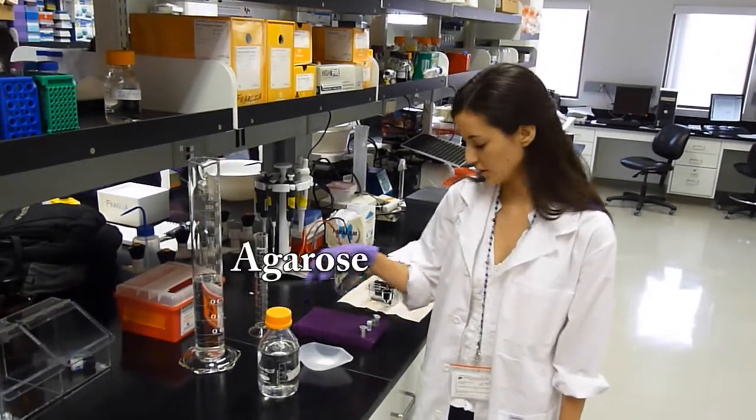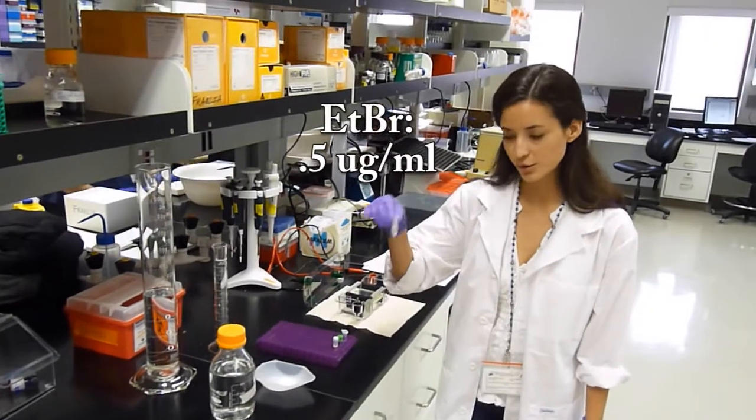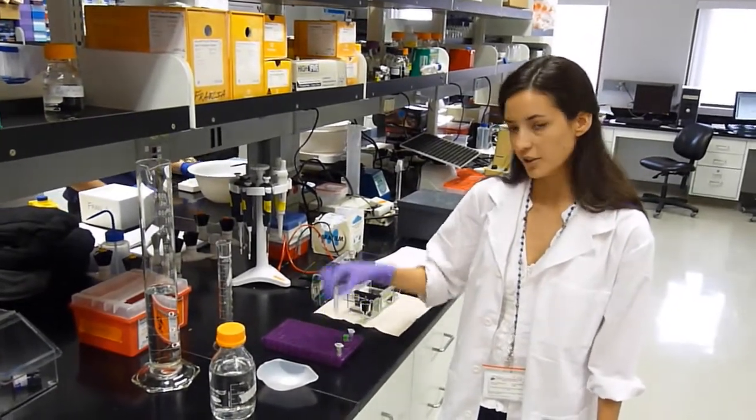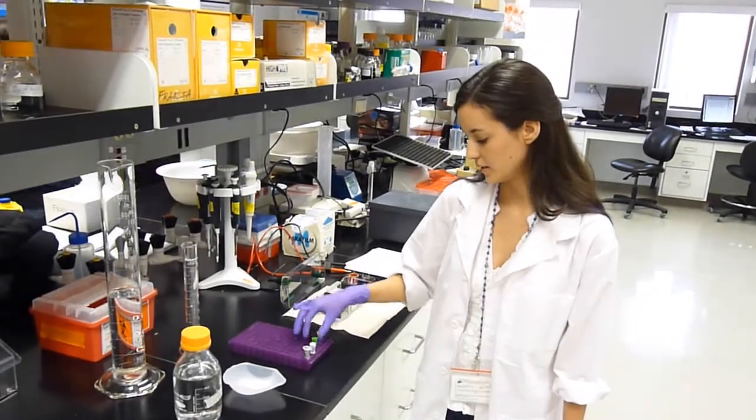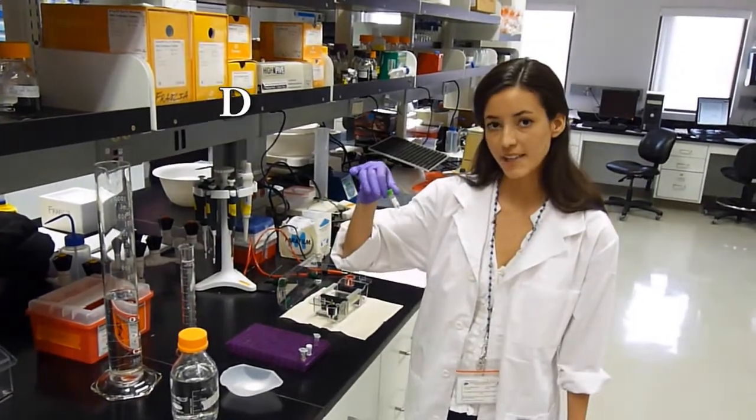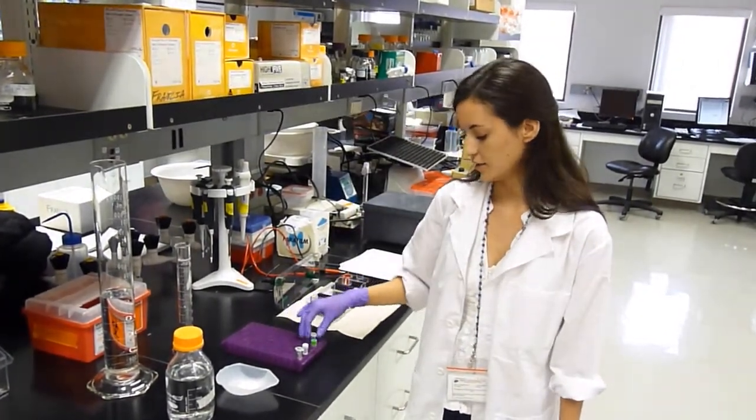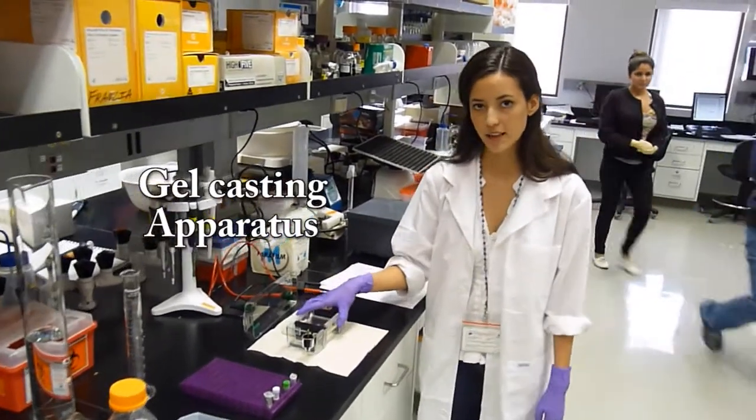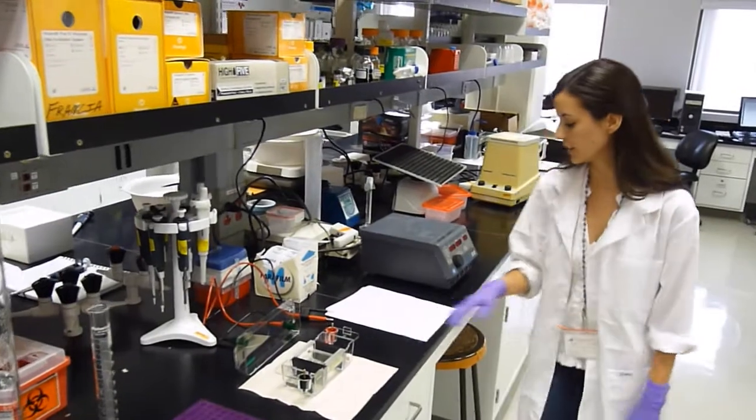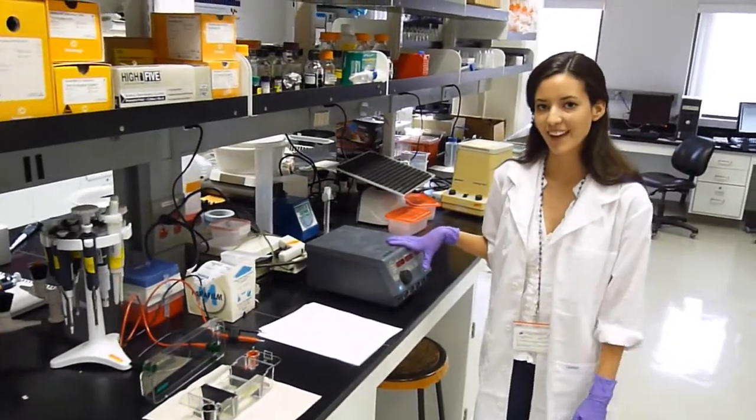You're going to need some agarose, ETBR solution, your 10 times loading buffer, your DNA ladder, your sample of course, and the gel casting apparatus. You will also need a power supply and a microwave.